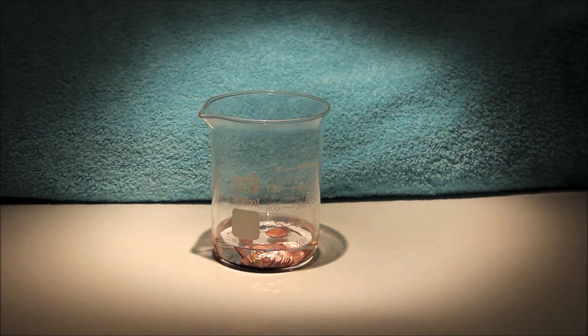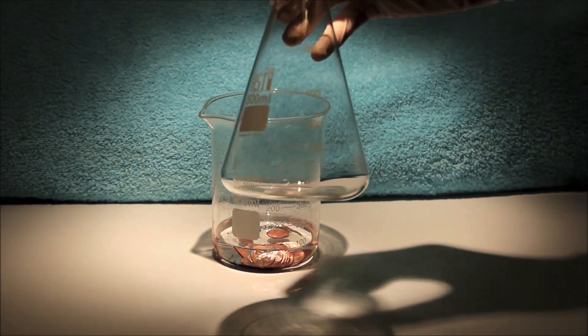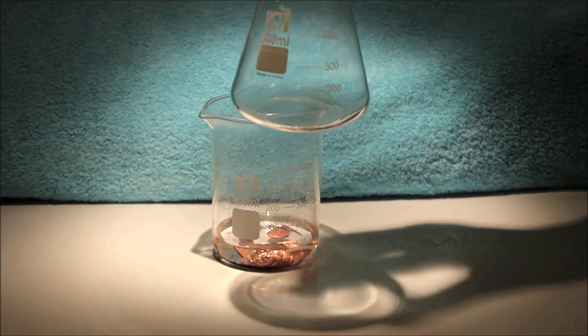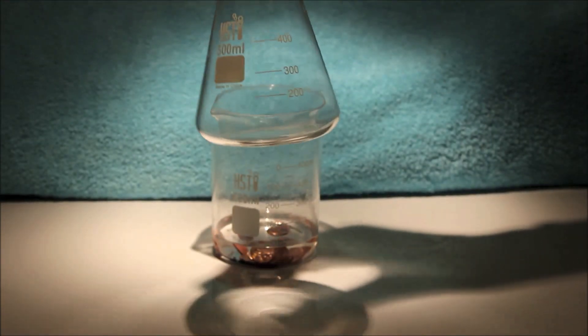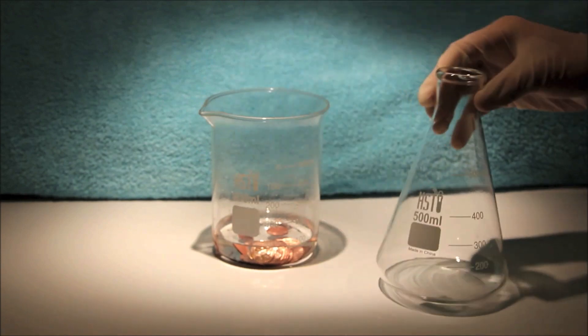Now I'm going to filter out the pennies and retain the solution for the second part of this video. Here I have an Erlenmeyer flask, which the solution will be contained in after filtering.